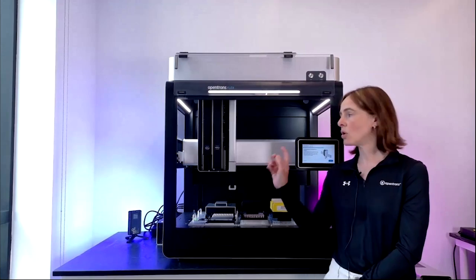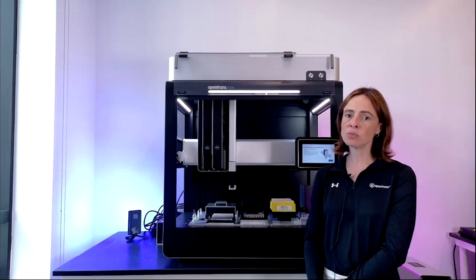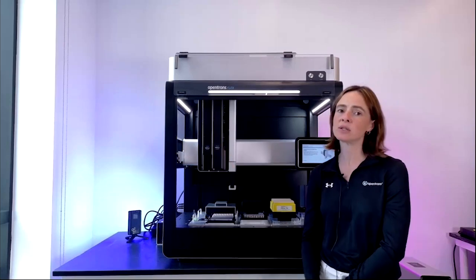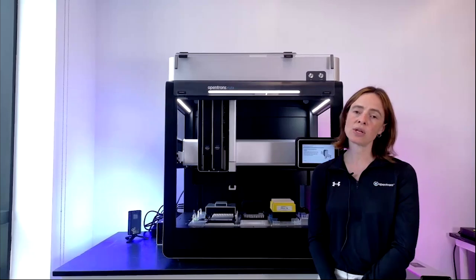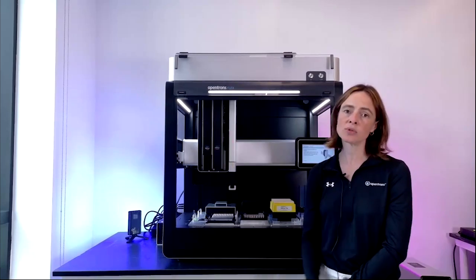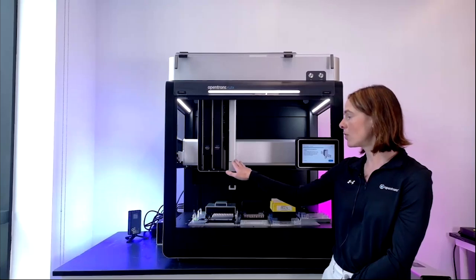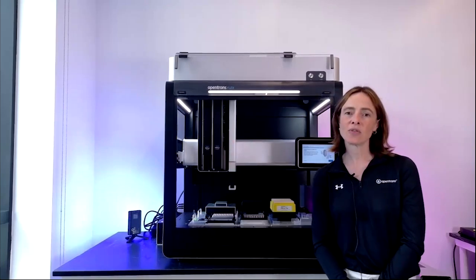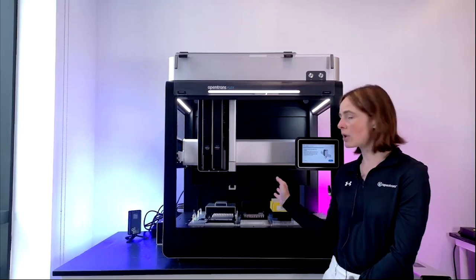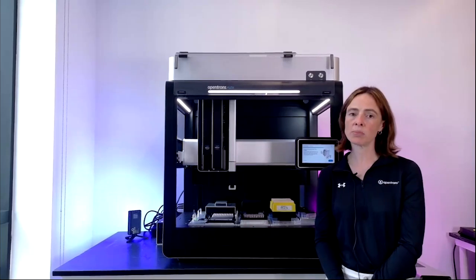One thing to note is you can hold any combination of single and 8s on the gantry. So you can have 2 singles, 2 multis, or as we have here, a single and a multi next to each other. Or you can have the 96 channel on its own, just because it takes up sort of the whole space here. And as I mentioned, we've got the gripper on the right-hand side or left-hand side, depending on how you're looking at it, of the pipettes, which can move tip racks and plates across the deck and into the trash bin at the back.